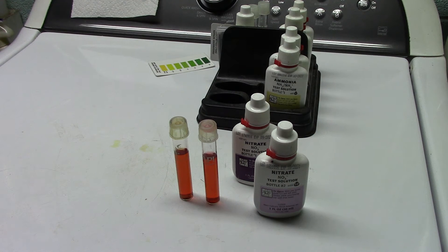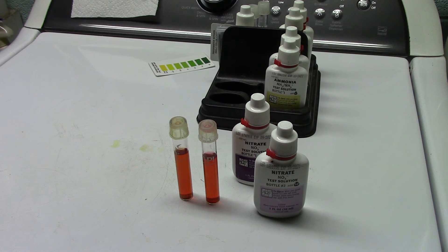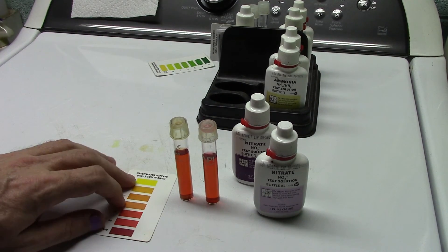So from one vial to the next, shake it again vigorously. Afterwards, just mix it up for 15, 20 seconds and as you can see you will get the exact same end result. So there you go. Butter beans tanks not as bad as I thought it was, we're still in the dark orange. So I'm gonna put that around 30 parts per million on the nitrates in his tank. And even though this is brackish water, we're in the very low end brackish and the fresh water test kit still works just the same.